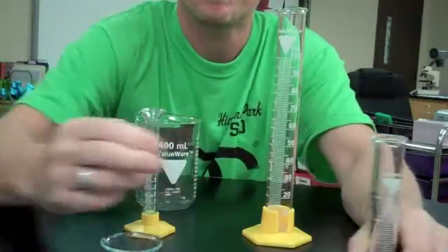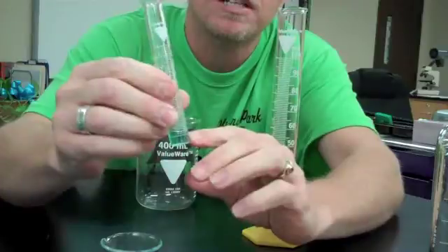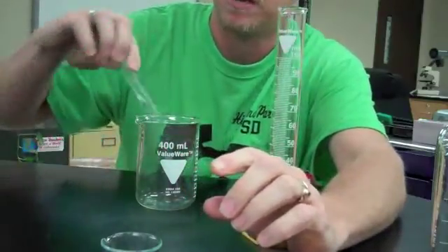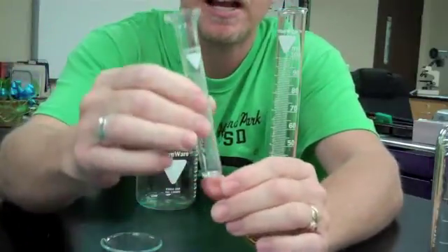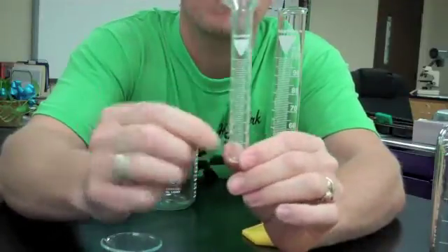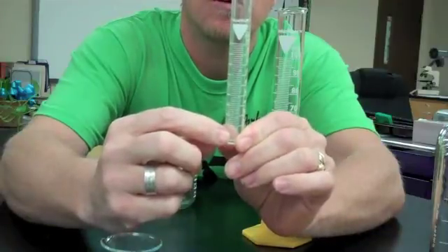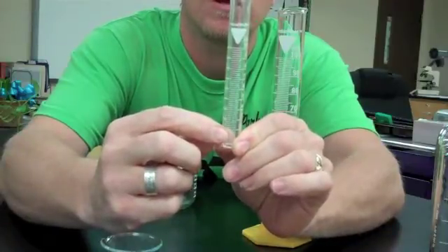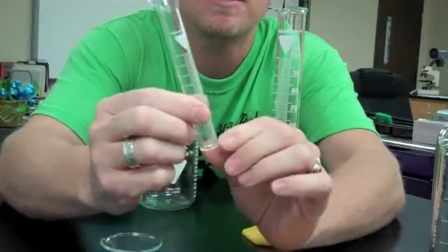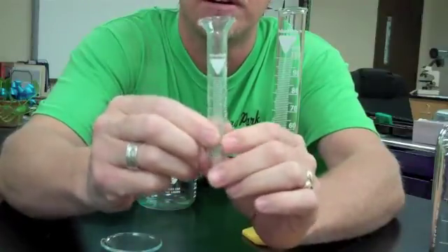If we go to a smaller graduated cylinder, you'll notice it is accurate at 1 milliliter, and I actually have a volume of liquid in here, so I want to pour that out for just a second. I can actually be accurate up to 1 milliliter, and the next mark is 2. So between the 1 and 2, there are marks that go up by 0.2 - so 1.2, 1.4, 1.6, 1.8, and 2 milliliters. This is accurate to at least 1 milliliter, and past that, accurate to a 0.2 milliliter volume.